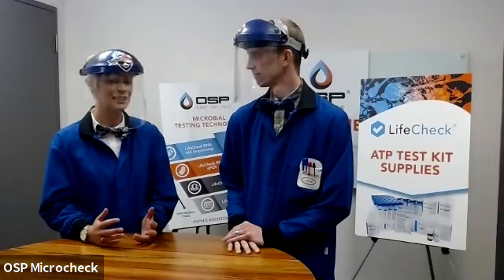So today we are going to be doing a live hands-on demo of our ATP testing technology. Just to let you guys know, we don't have a huge production budget, so this is going to be very similar quality to a YouTube or one of your video conferencing. Because Mark and I are going to work so closely together today, we are wearing face shields rather than the surgical masks. So we have a barrier in alignment with our COVID-19 safety procedures, but you can still see us and hear us throughout the webinar.